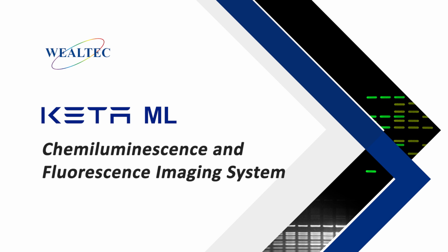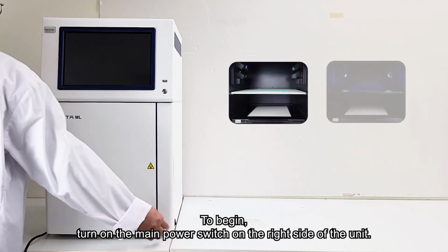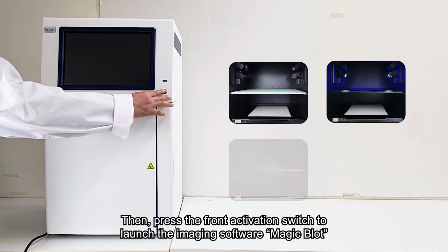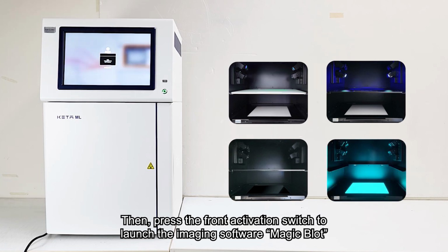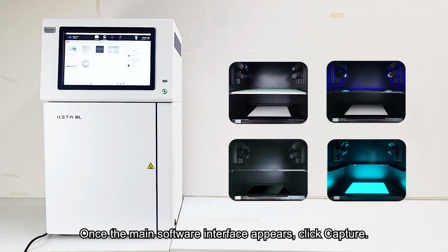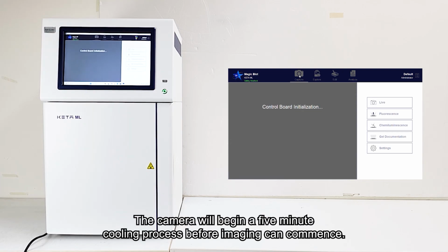Operating Features Overview. To begin, turn on the main power switch on the right side of the unit. Then, press the front activation switch to launch the imaging software, Magic Blot. Once the main software interface appears, click Capture. The camera will begin a 5-minute cooling process before imaging can commence.